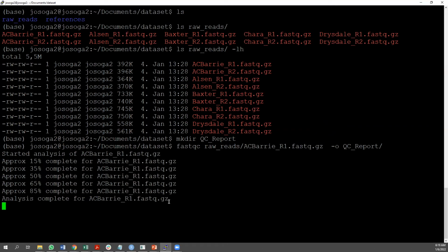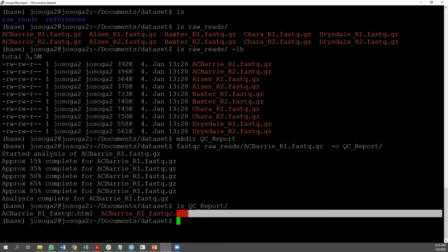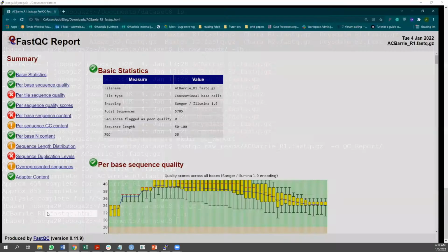Okay, let's just wait while it completes and compiles our reports. Now the report is compiled. You can try to list the files inside your QC reports, and you have an HTML output and you have a zip output. Now the zip output contains some of the graphics that were used for assembling the HTML report. Because it's an HTML report, you can open it in your Google Chrome browser or Firefox or whatever. I have opened mine, and here we go.